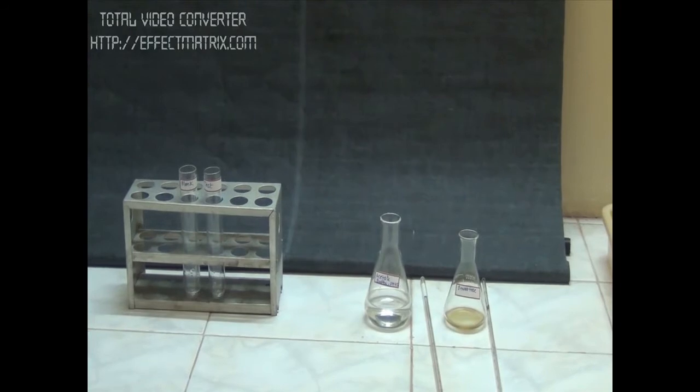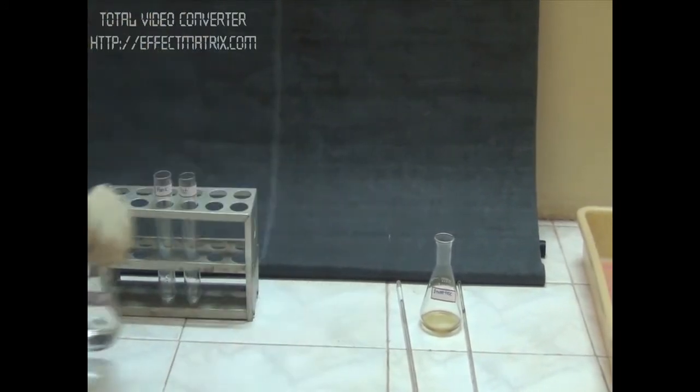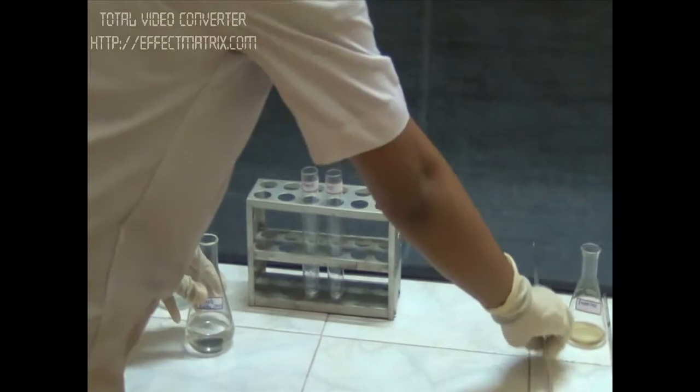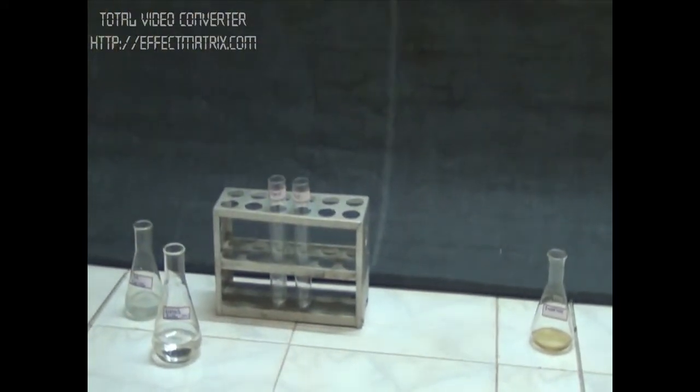I've added substrate to both blank and test tubes. Now we add acetate buffer to maintain the pH at 4.5.